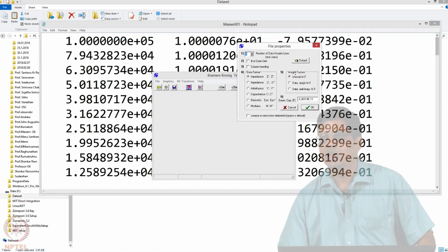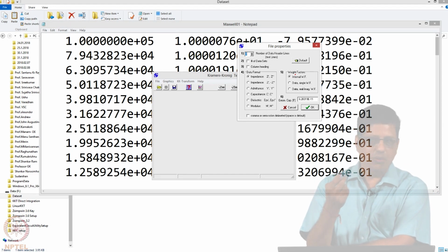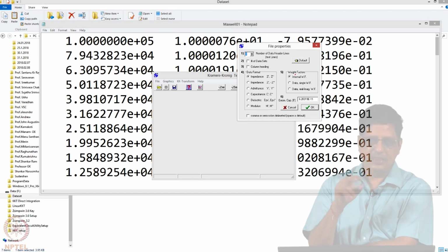Weight factor. You can tell the standard deviation or how much weightage you have to give for each data point. Sometimes you may have more confidence in the high frequency data and less confidence in the low frequency data, in which case you can say give more importance to the high frequency data and see if that fits well.